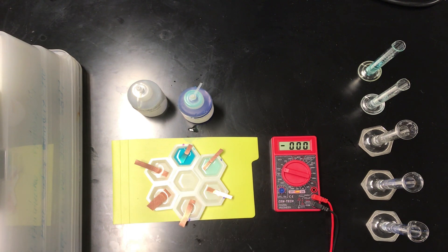In each of these we have a strip of copper metal. So each is a copper copper 2 plus, or copper 2 half cell, and we're going to connect these together to see if we can achieve a voltage.